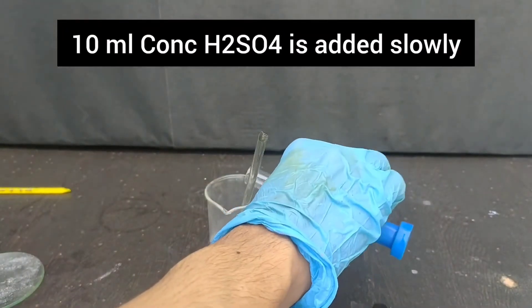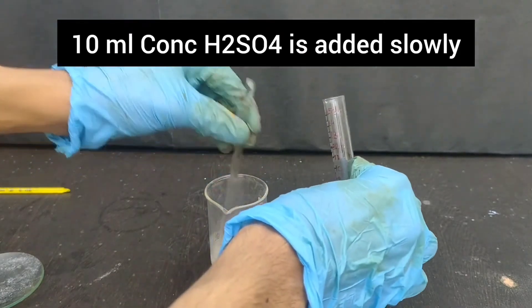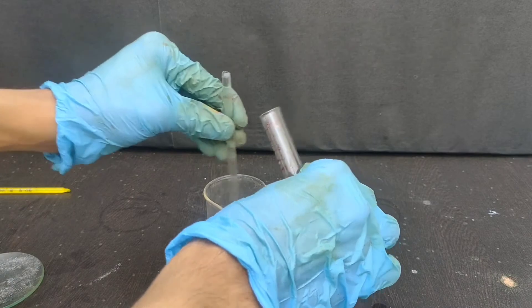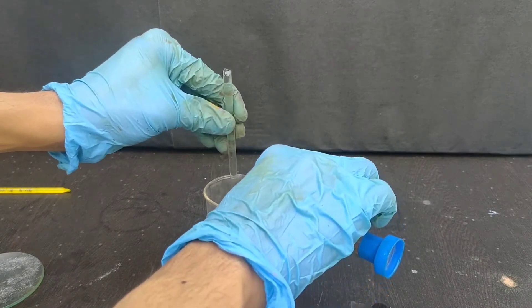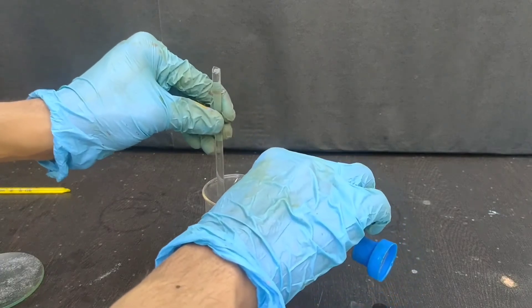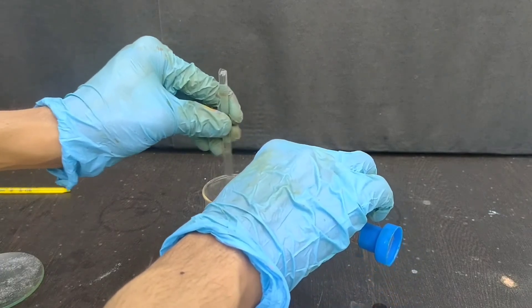10 ml of concentrated sulphuric acid was added. On adding sulphuric acid, the solution cleared up.